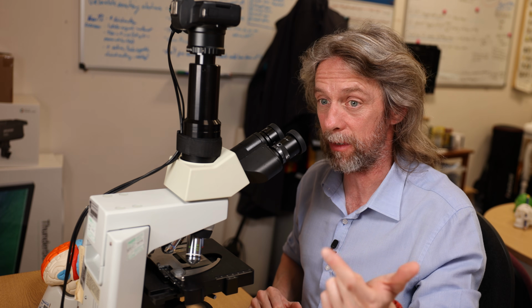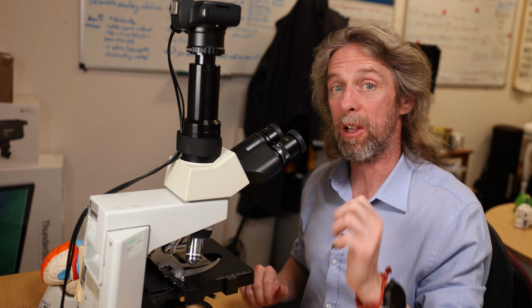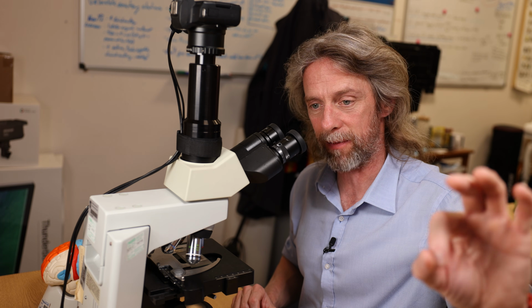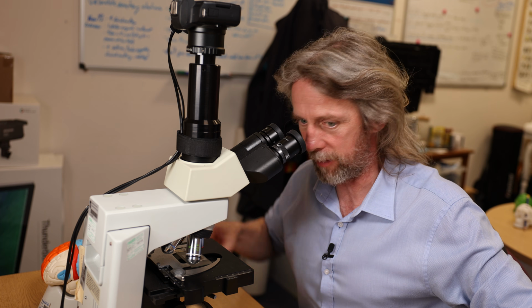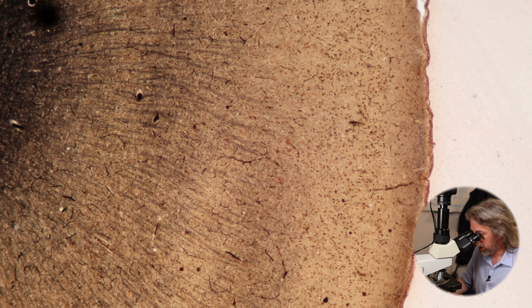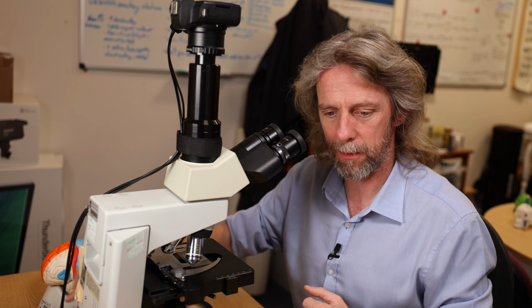Neurons, oligodendrocytes making myelin, astrocytes doing pretty much everything, microglia clearing up after everybody, lots of capillaries, and the white matter being the tracts of axons going off to somewhere else and carrying those action potentials to wherever they're needed, whereas the grey matter is where you have those connections.